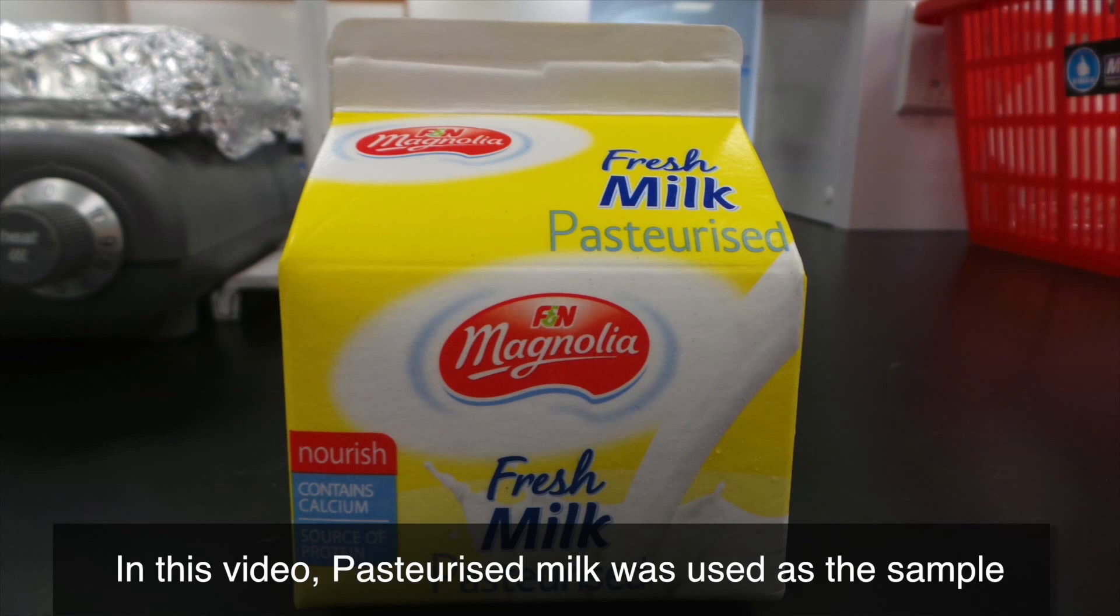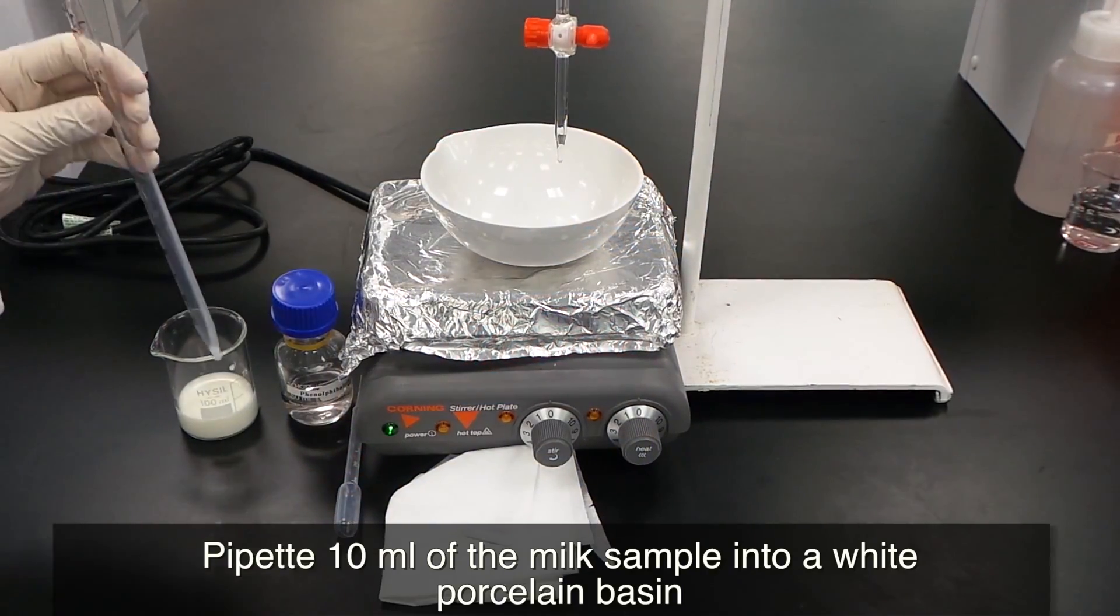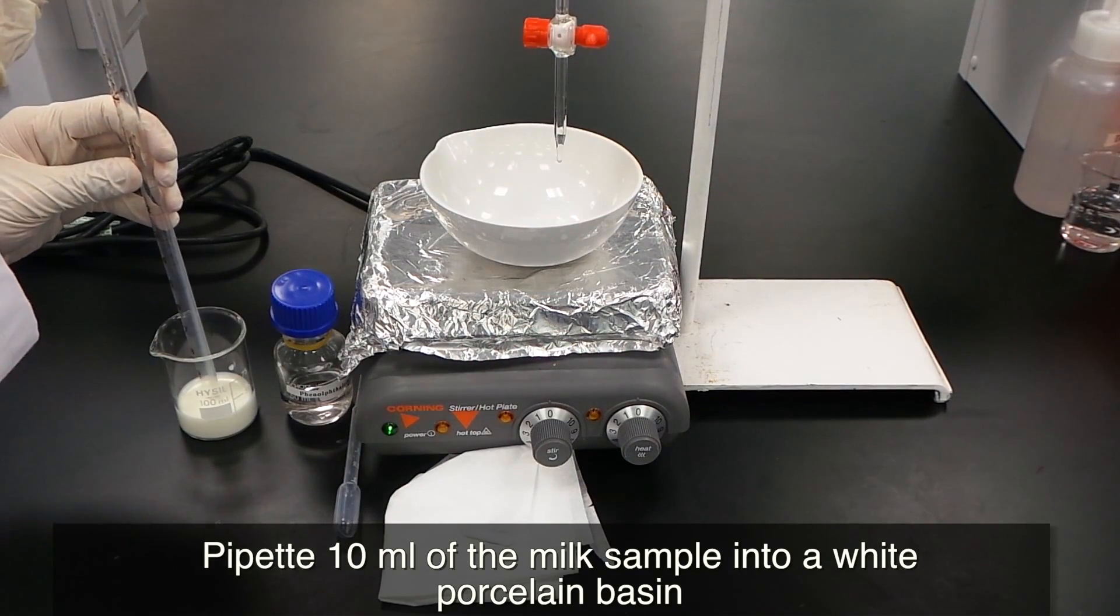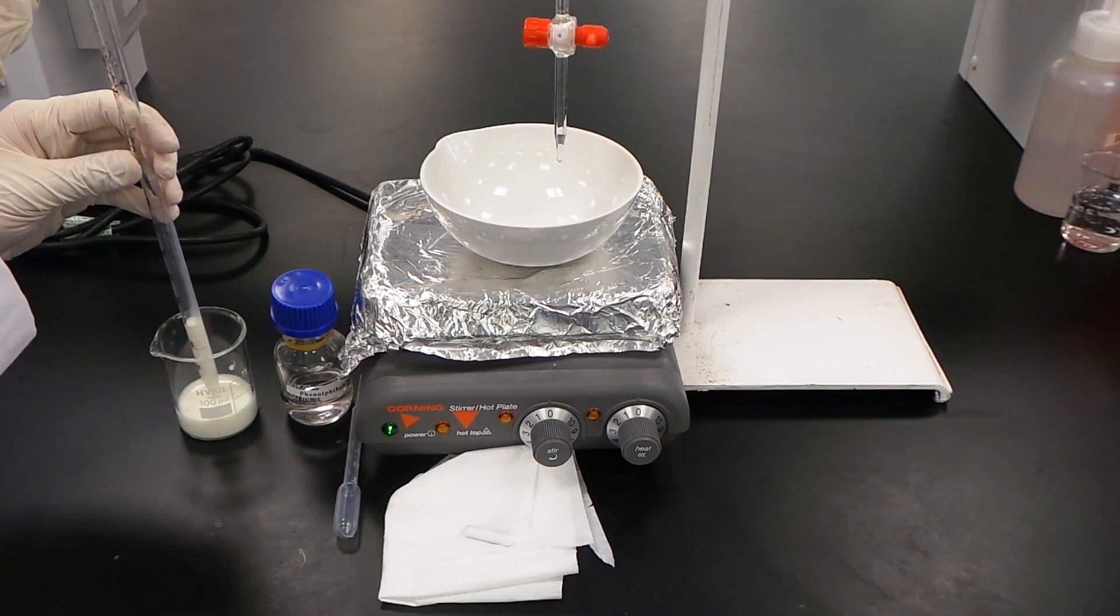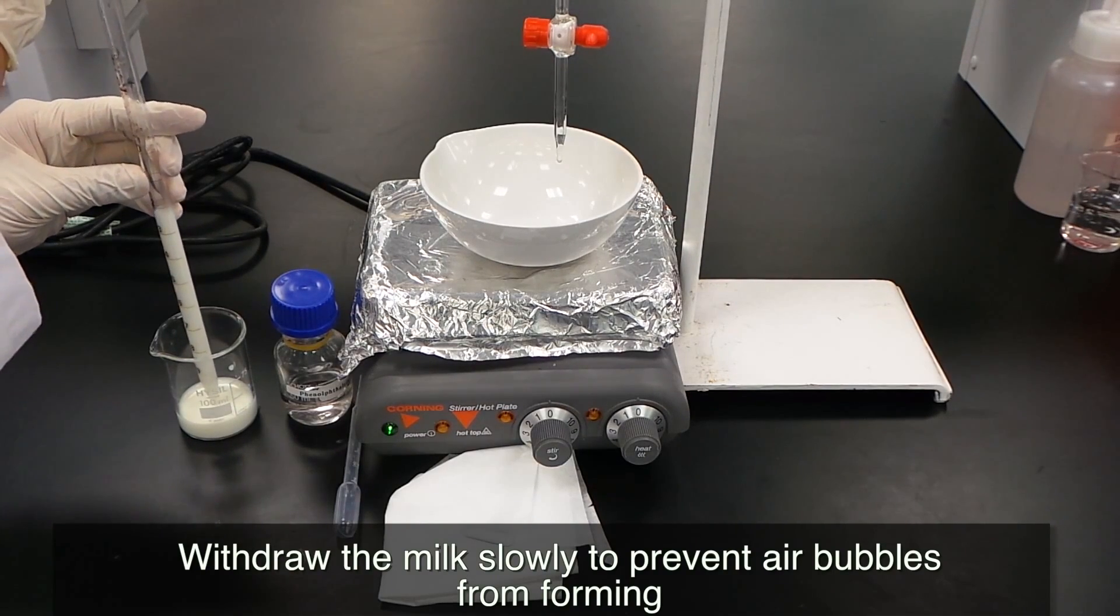In this video, pasteurized milk was used as the sample. Pipette 10 ml of the milk sample into a white porcelain basin. Draw the milk slowly to prevent air bubbles from forming.